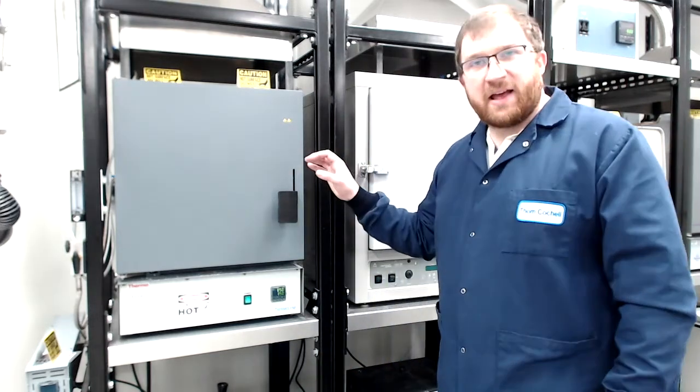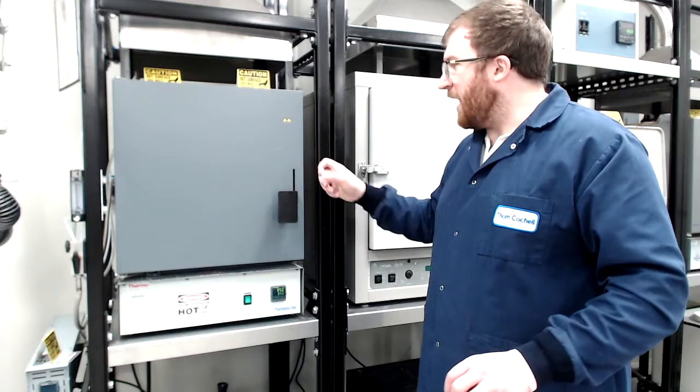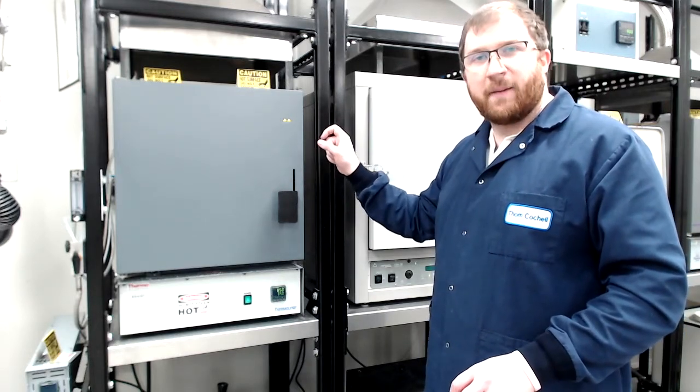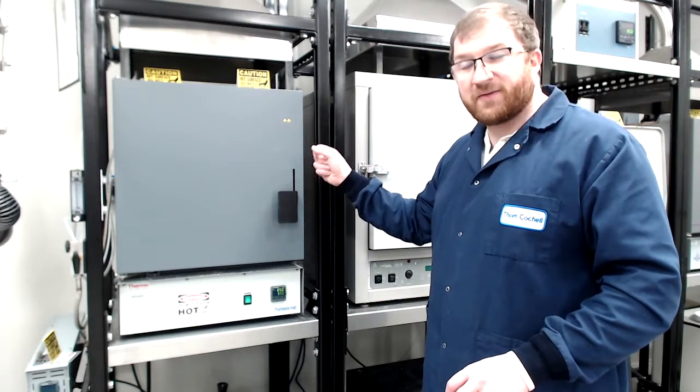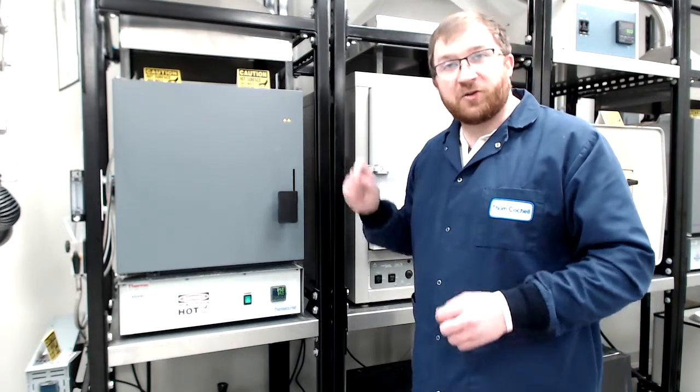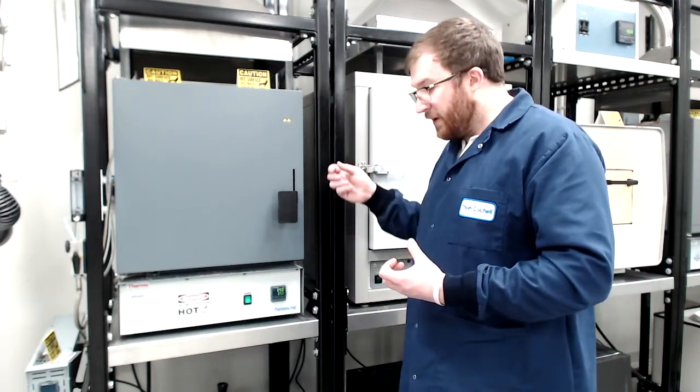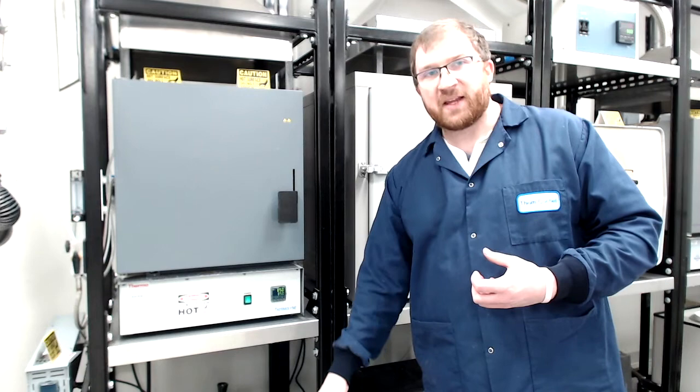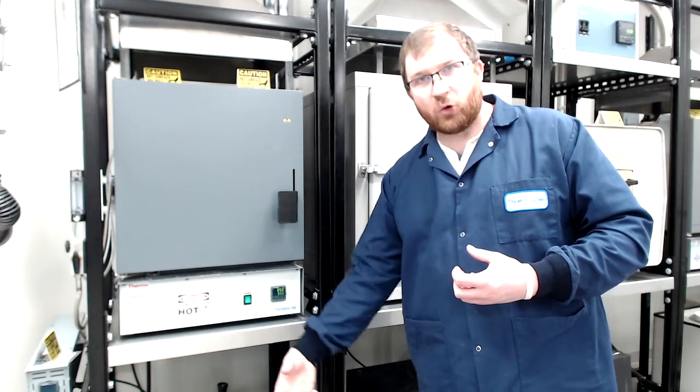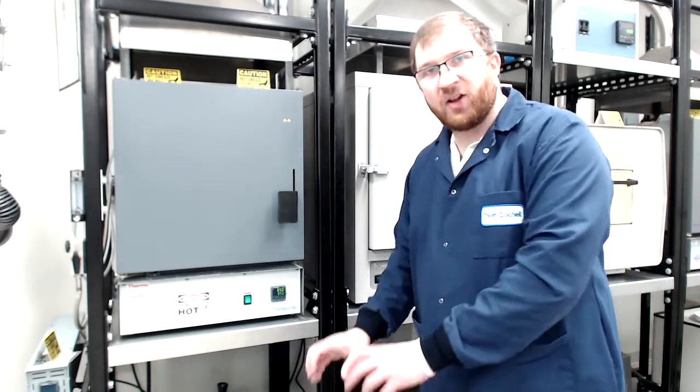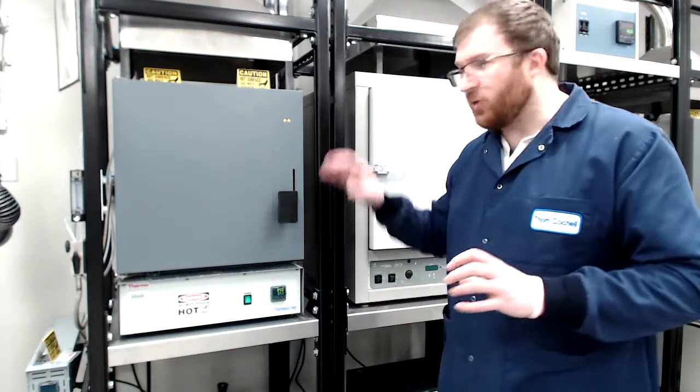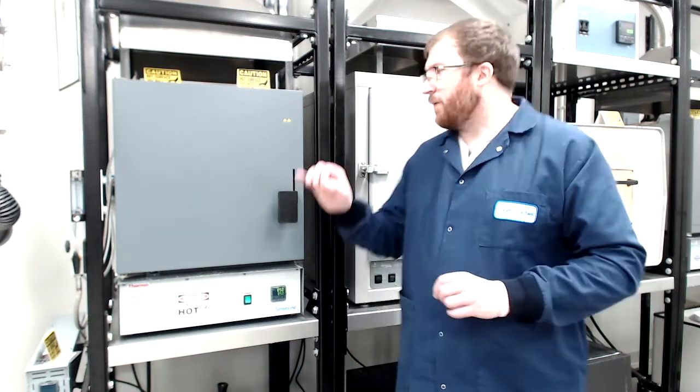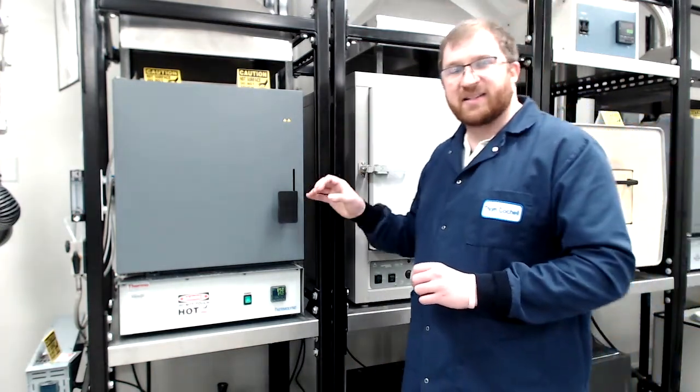So in the next part, we'll get set up. I'll show you us taking out the steel tensile samples from the furnace, from the austenitizing furnace. Note the temperature by the color that comes off. And then we're going to quickly place it in the quench oil. And I'll show you as it's cooling down in the quench oil. So we'll get a shot of the oil there. So stay tuned. We'll get reset up. And then you'll see the quenching process from 850 austenitized furnace.